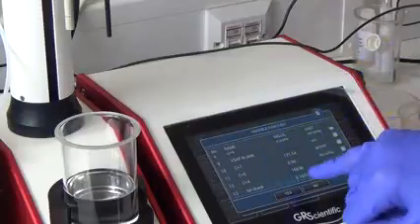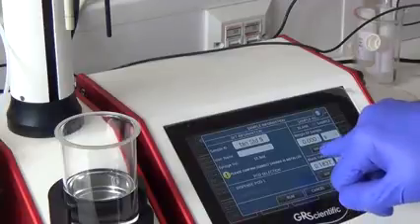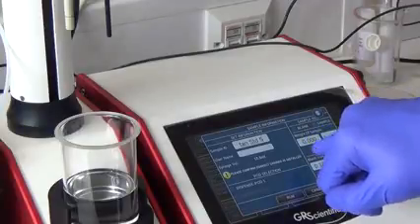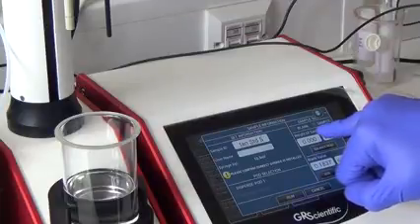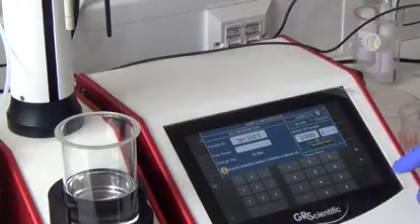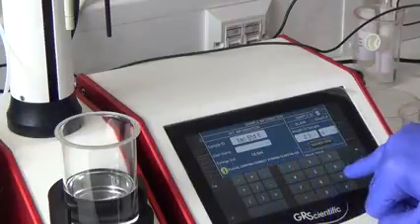So we can scroll down. Select. Yes. And again, if you need to, you can add that in manually yourself. And then the weight of the sample for this standard is 2.1900.